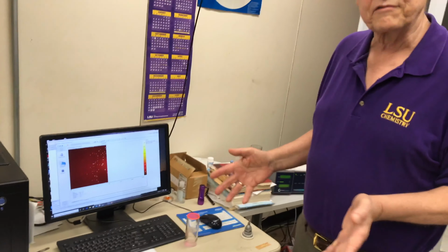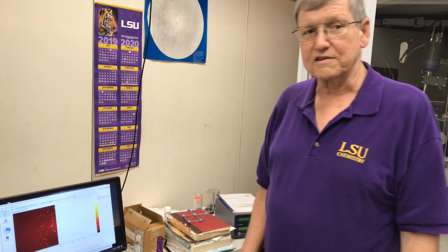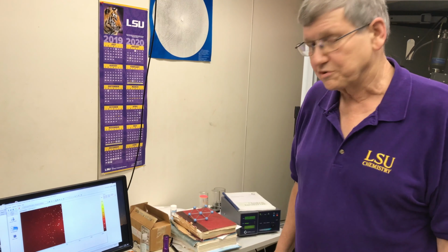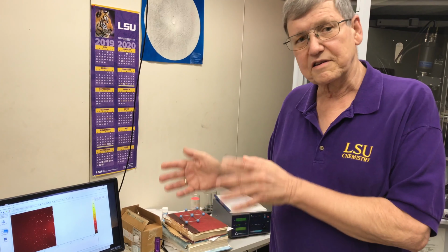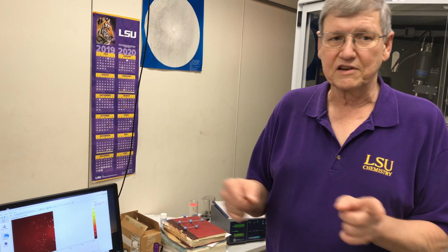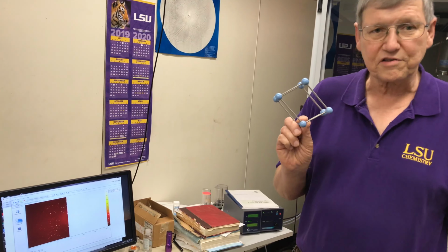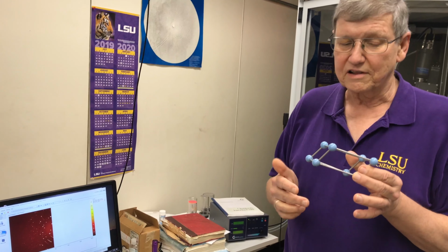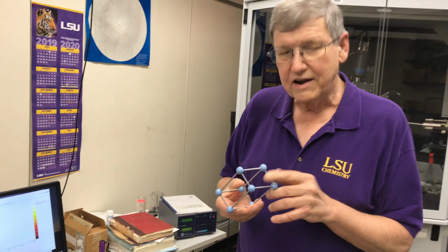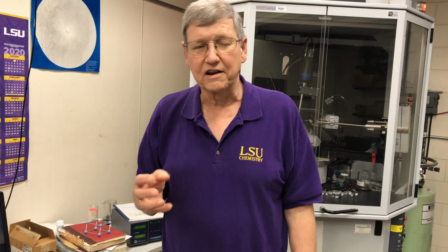So over a matter of several hours, we will gather all those intensity data, measure all the intensities of each one of those spots, which are maybe tens of thousands. And the nice thing about that set of intensities is that when you take the Fourier transform of that set of intensities, you get three-dimensional electron density within the unit cell of the crystal. And the nice thing about three-dimensional electron density in the unit cell is that it's pretty close to zero most everywhere, except where there's an atom. Right? And we get a peak in the electron density at the three-dimensional coordinates where there is an atom.